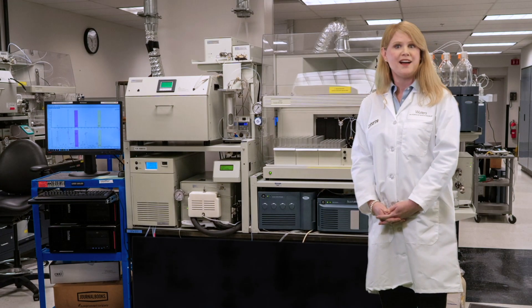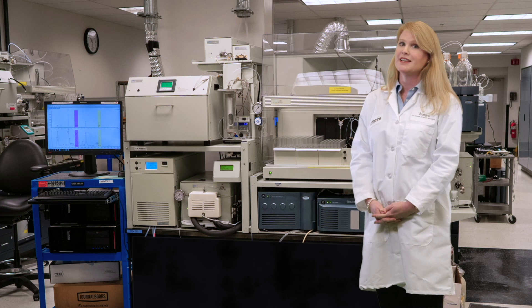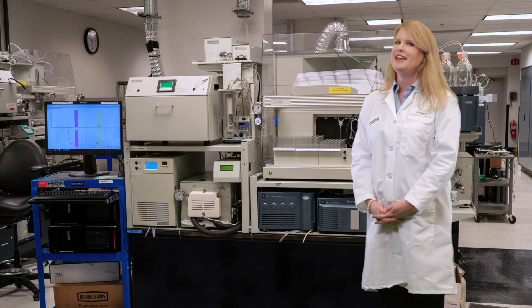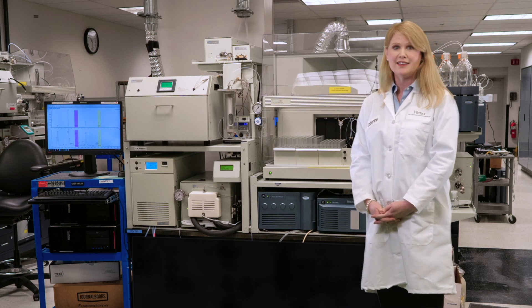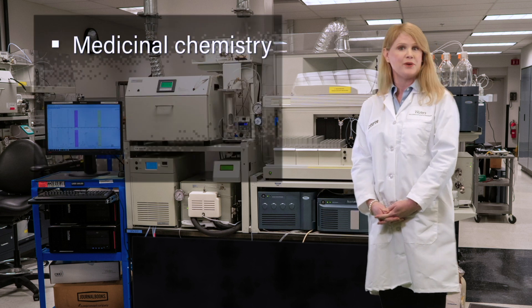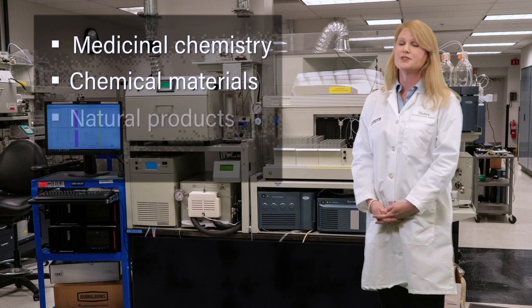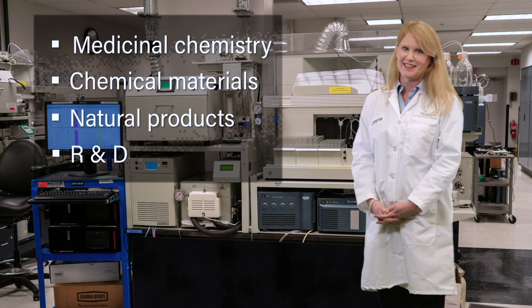The system is designed for high-throughput isolation of sample compounds in an automated fashion. It is widely employed in a variety of industries such as medicinal chemistry, chemical materials, natural products, and R&D.